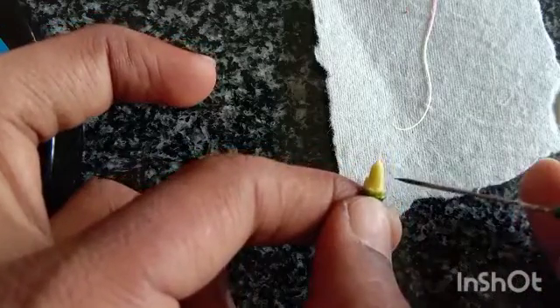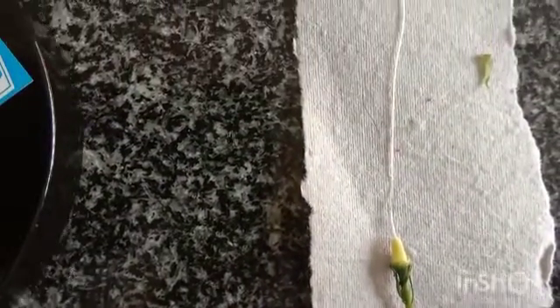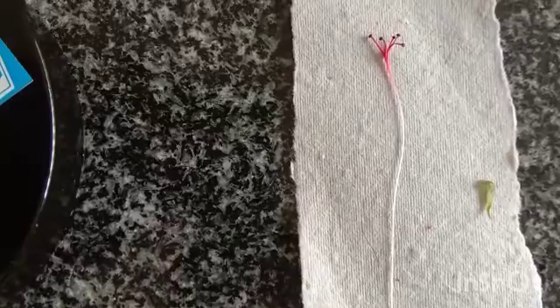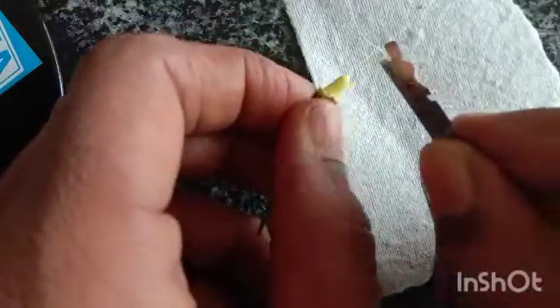This is the ovary, which is connected to style and stigma. Now this is the female reproductive part of hibiscus flower. Now cut the style with the help of sharp blade. This is the ovary.